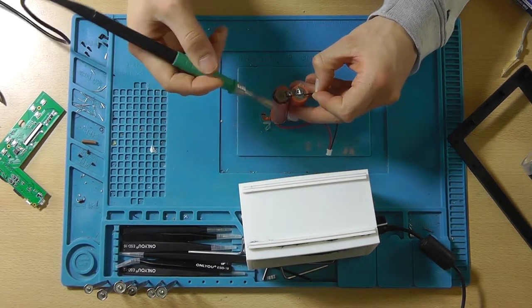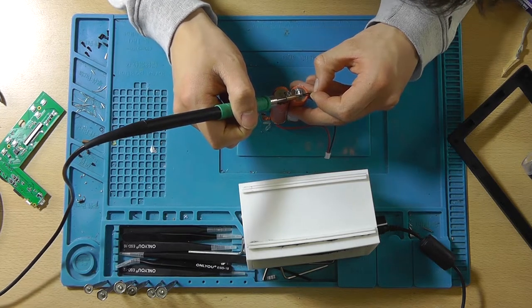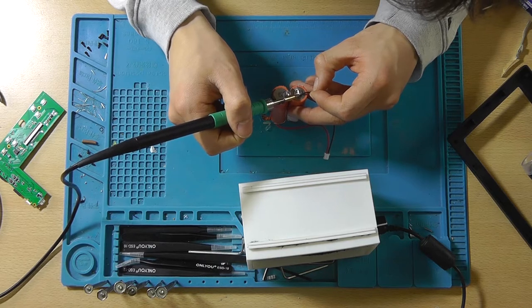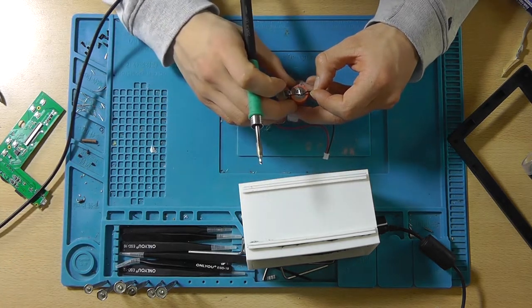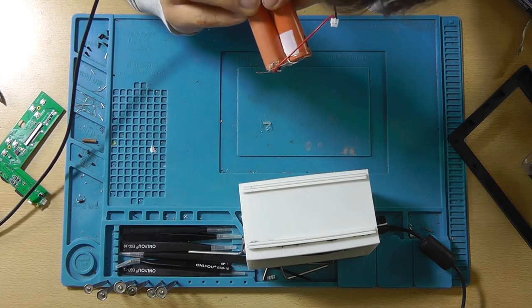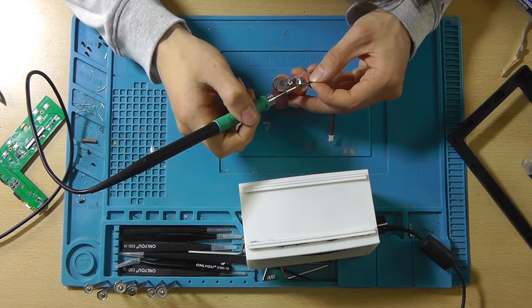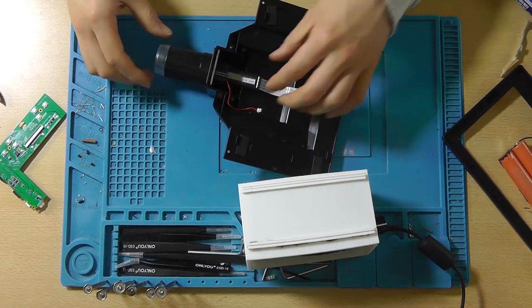I'm really starting to love this soldering iron. It's quick. It solders pretty well. It's got plenty of power, obviously. I mean, it's a 130 watt soldering iron, so you would expect it to have plenty of power. Now we can actually put it back together.